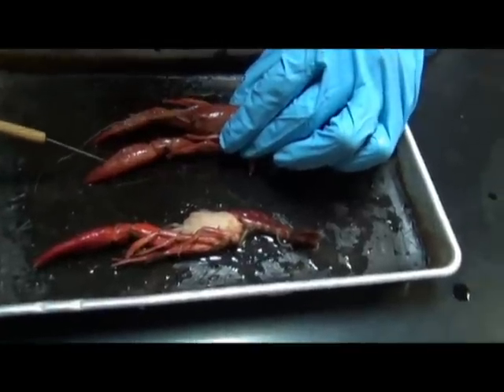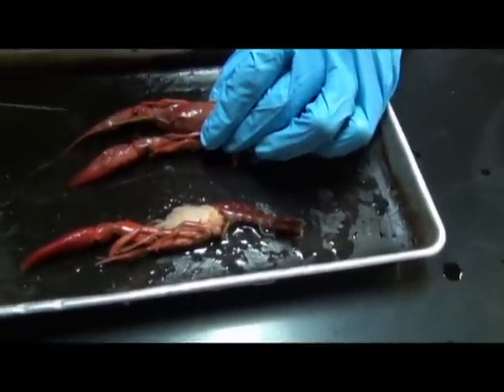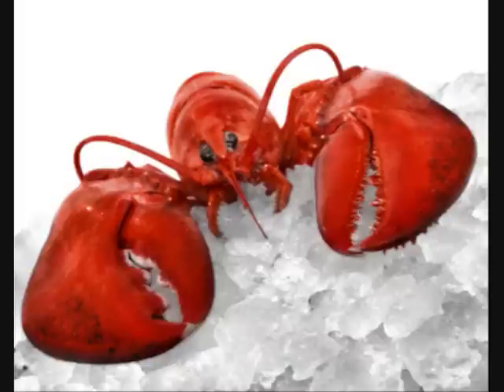Now, you can't really see it on this guy, but if you were to look at a clawed lobster, a Maine lobster, what you'll notice right away is that one claw will actually have what looks like molars, and that claw is pretty much adapted for crushing things. The other claw will have things that look like sharp edges, and that claw is pretty much adapted for tearing things.